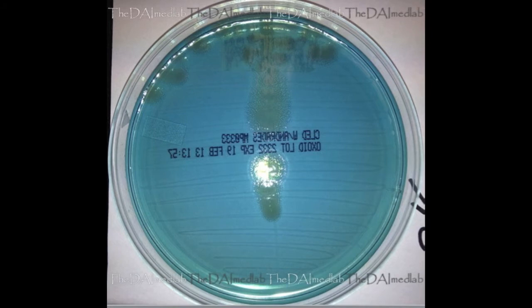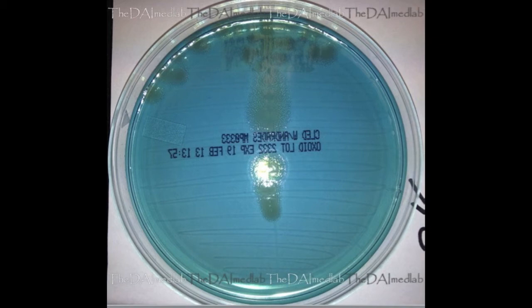On CLED Agar, Pseudomonas aeruginosa is a non-lactose fermenter, and it appears as medium to large, gray, irregular, semi-translucent matte colonies.